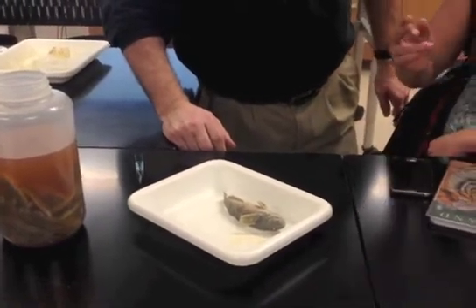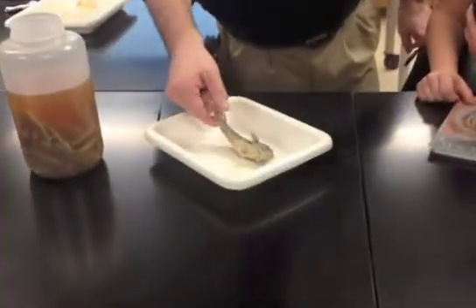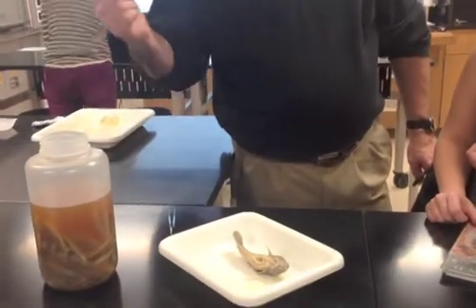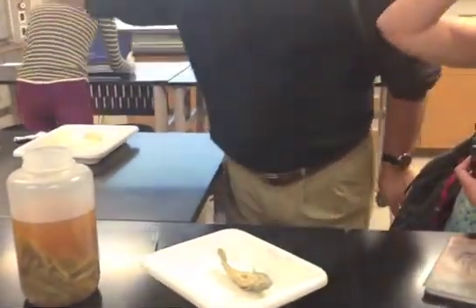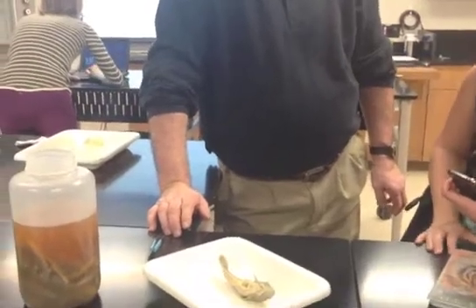It's surprising that it's external. So that's all you're going to do, and then get a weight. If that scale is not going to work, use the scale next to it. Ideally we'd like to get at least two decimal places, if not three, because that would be to our advantage.